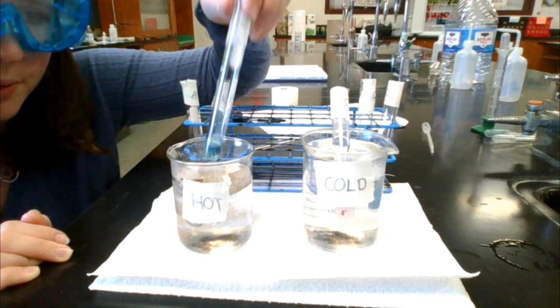This is due to our own impatience and wanting it to display a stronger color reaction, to display a stronger blue. What I didn't expect to happen was for it to instead go this pinkish color. Why this happened was because the chloride stopped being potent, adding so much of it, but the water started to become more prevalent a factor as the water became more and more of a percentage of the solvent mixing with the ethanol, or I don't know what's ethanol, the alcohol.